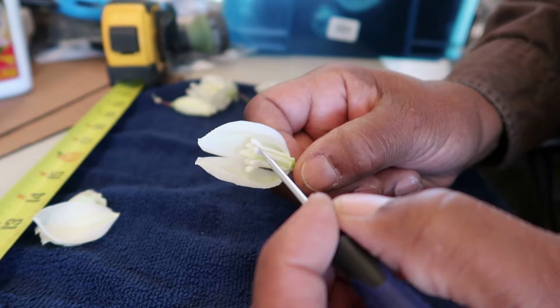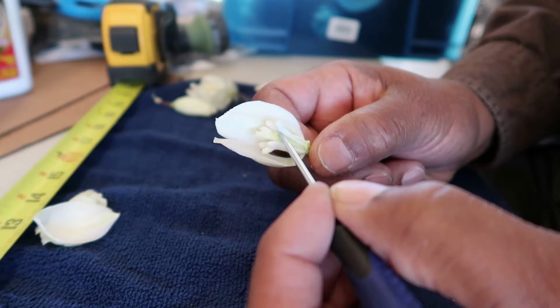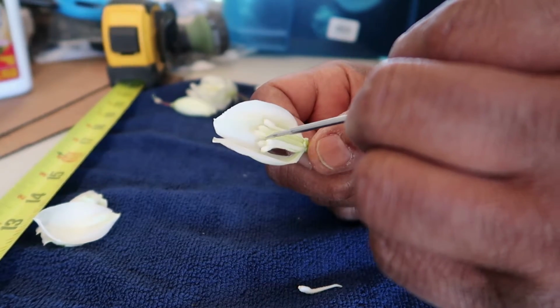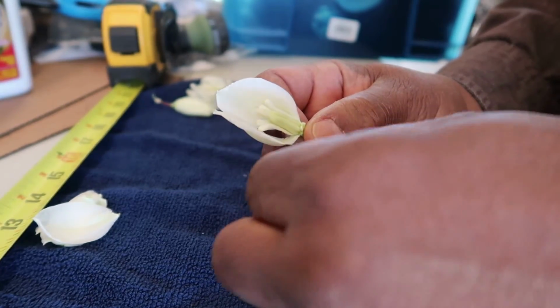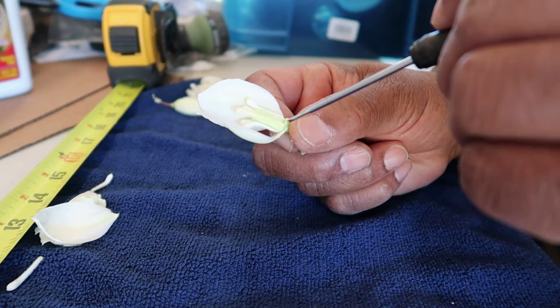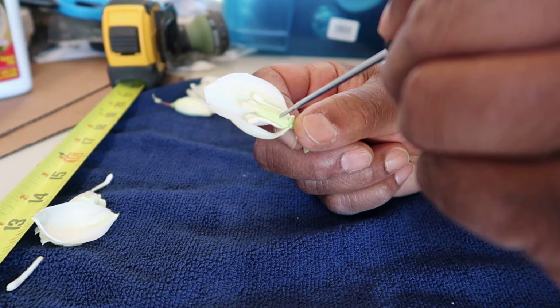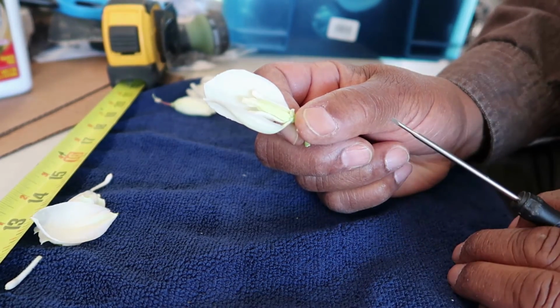Pollen, anther, filament. The whole thing is called stamen. This is the male reproductive part. Let's remove a couple of those and put them up here for measurement purposes. And at this point, one can clearly see stigma, style, ovary, pistil is the name for all 3 of those parts.